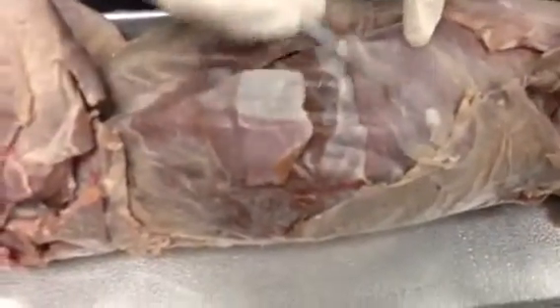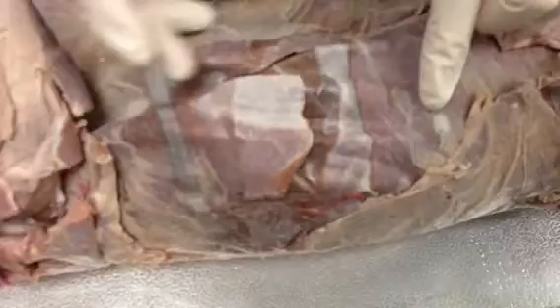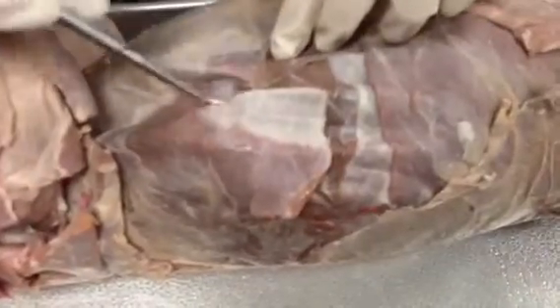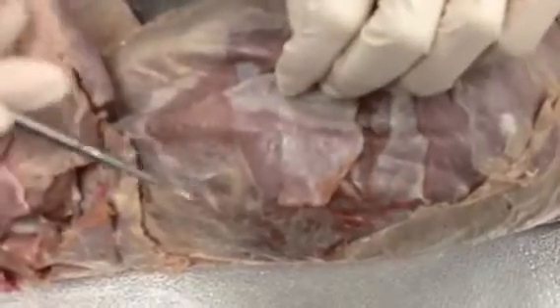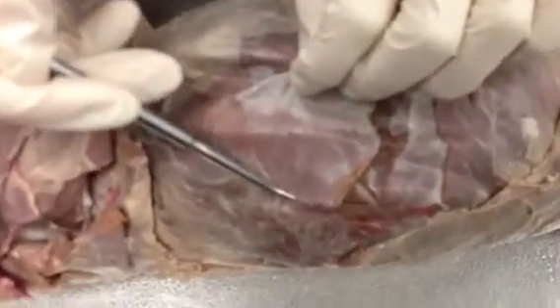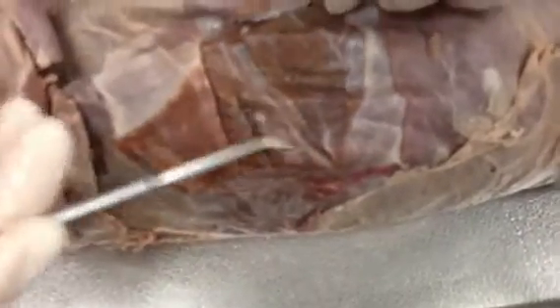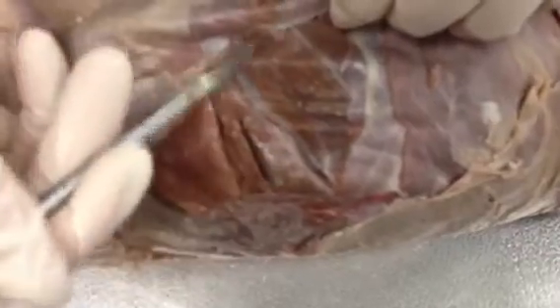And the external oblique's been cut off right here. And then these are external obliques. And then the aponeurosis of the internal oblique is here, and part of it's been cut off here. So this is external oblique, internal oblique, and then deep to the internal oblique, you have the transversus abdominis muscle here, and you can see the muscle fibers run a different way.